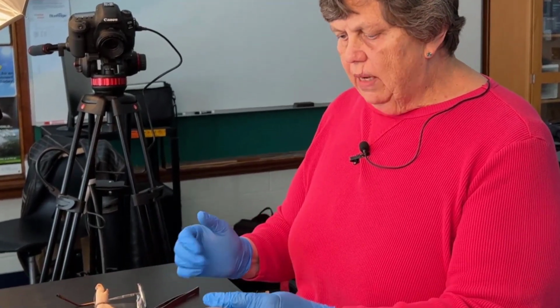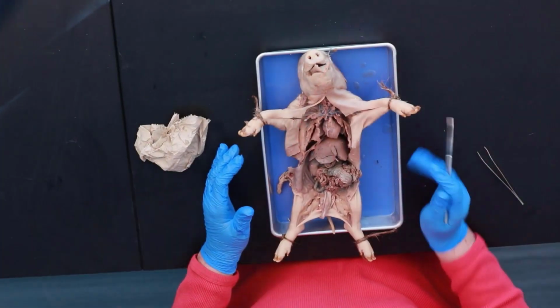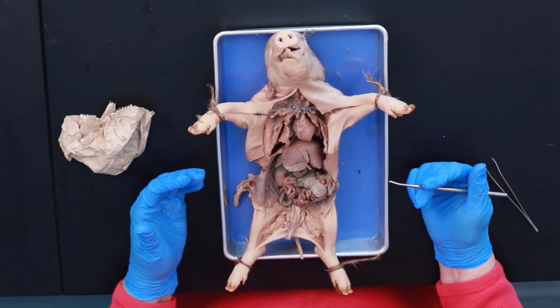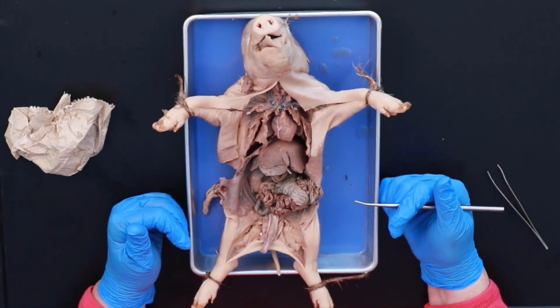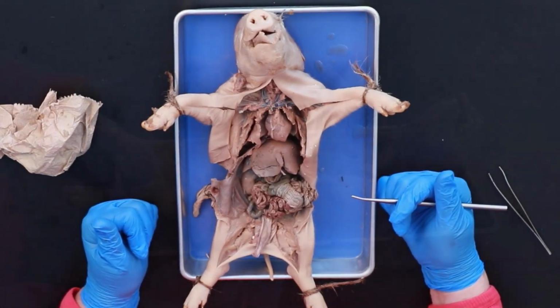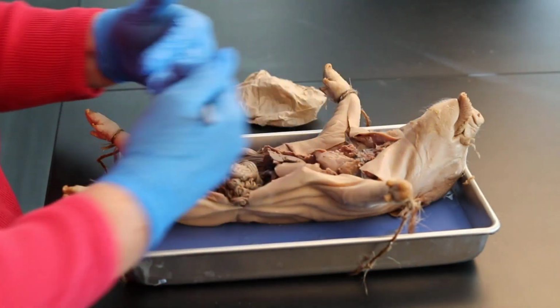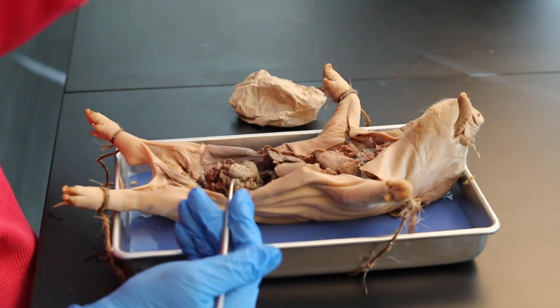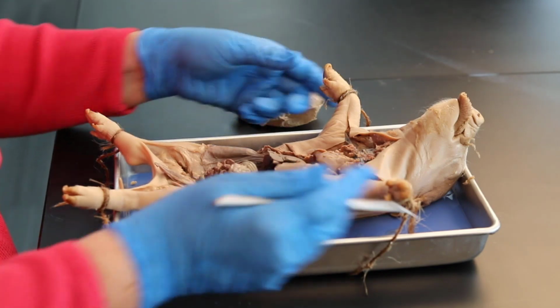So here's the fetal pig. I'm taking you into the laboratory, and we're going to go through the fetal pig, and hopefully this will help you understand some of the organs and see some of the vessels and how they're actually structured, and maybe this will make this a little bit easier for you. This is something we actually do if you're taking the course live or you're coming in for a lab. You're going to be dissecting a fetal pig. And isn't that gross? Okay, but I wanted to go through the entire fetal pig with you in one session. This will take you through this and make sure that you're aware of this.